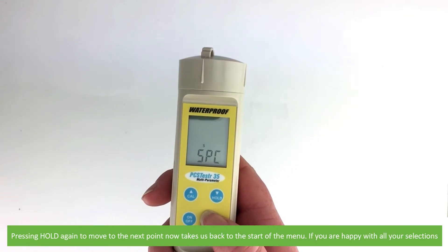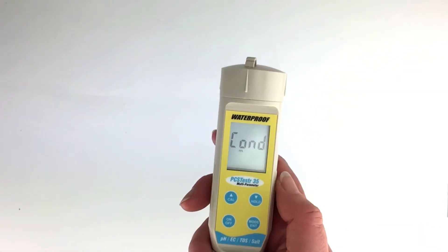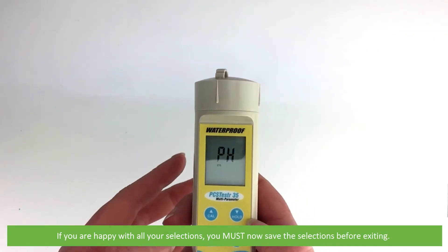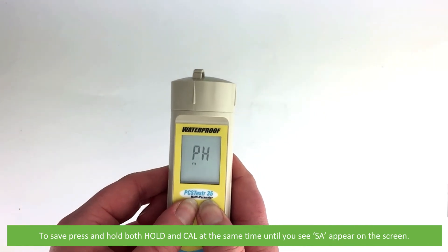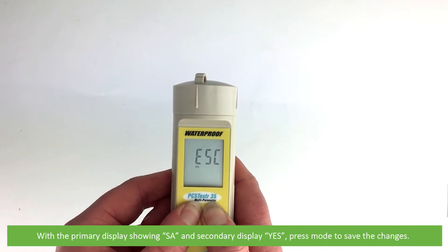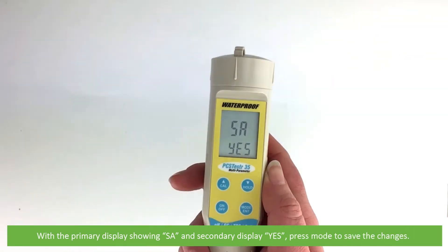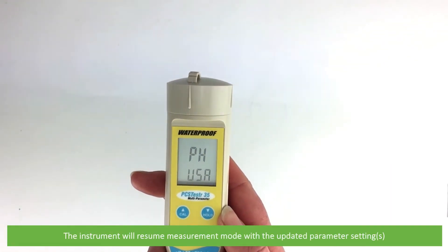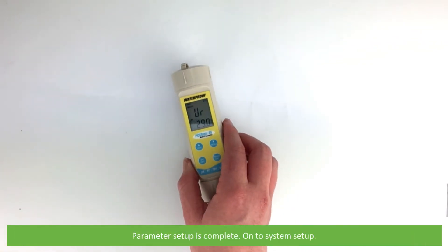Pressing hold again to move on to the next point now takes us back to the start of the menu. If you are happy with your selections, you must now save the selections before exiting. To save, press and hold both hold and cal at the same time until you see SA appear on the screen. With the primary display showing SA and the secondary display showing yes, press mode to save the changes. The instrument will resume measurement mode with the updated parameter settings. Parameter setup is now complete.